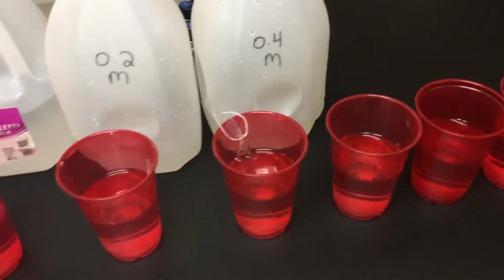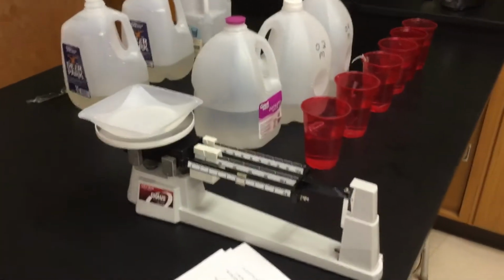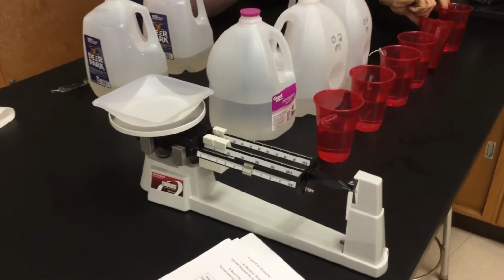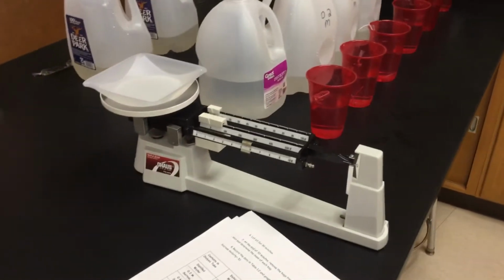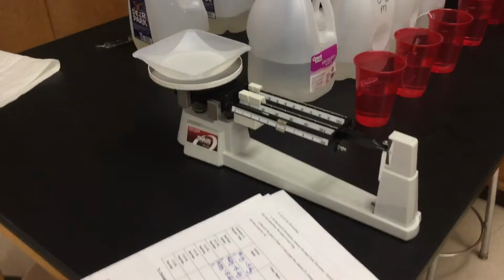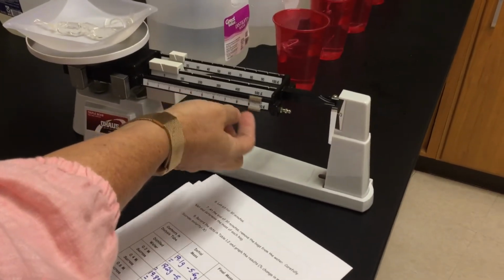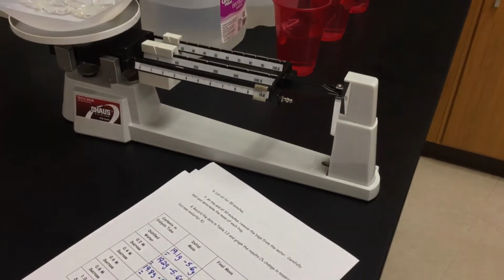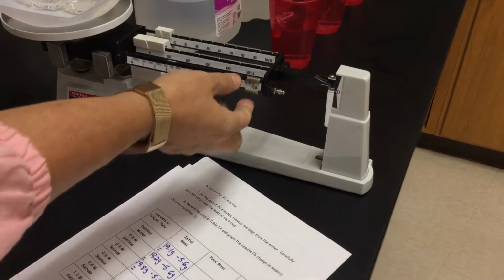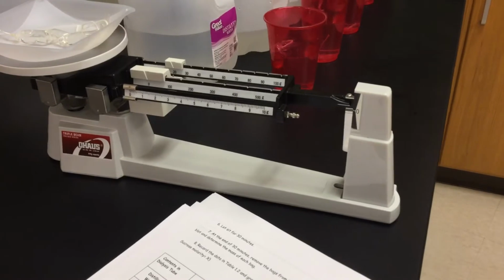And we're going to go up to my 0.6. So my solutions are getting a little more sticky along the way. You can hear my shoes actually sticking to the floor where we spilled some along the way. I reset my weigh boat. We're still at 5.6. Let's check this one out. We're on 0.6 molarity. Might have to bump this one up a little bit. So we're going to go all the way back. We're going to increase this to 20. Remember, my sugar solution is getting a little bit more concentrated as we go along here.